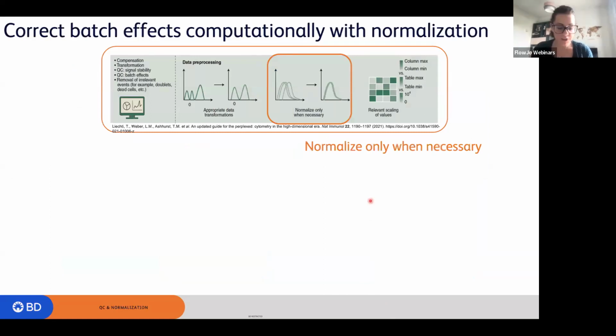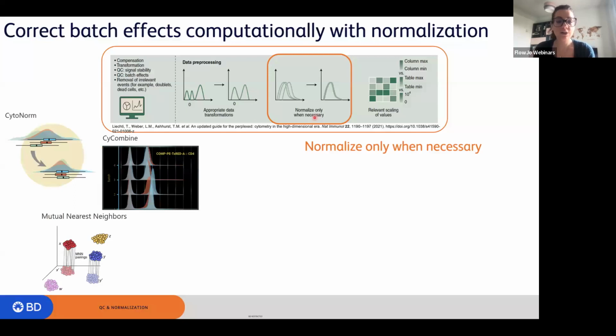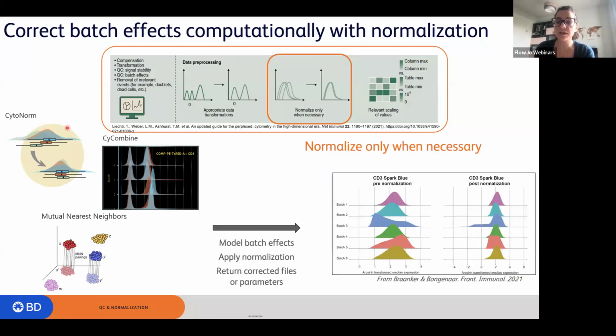So what we can do, first of all, in this beautiful figure right here, there is one sentence which I like, which is normalize only when necessary. Why do you want to do that? Because if you do have small biological differences, you may lose that with normalization. Okay, with this being said, we do have a few tools for normalization, and they are CytoNorm, cyCombine, or MNN. These tools basically model the batch effect and apply normalization, and what they give you in return will be corrected files or parameters. And here is an example of how the different batches look for CD3, for example, before and after normalization. And as you can see, we try to normalize the signal for each marker across different batches.